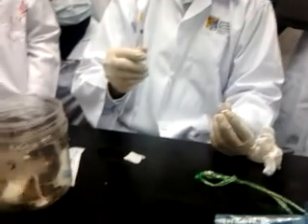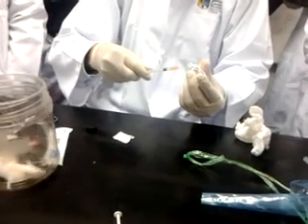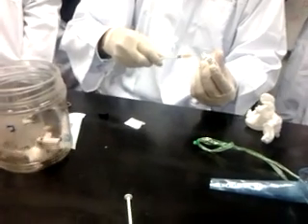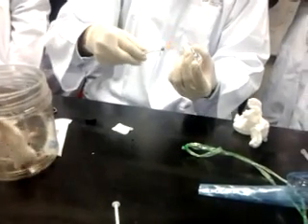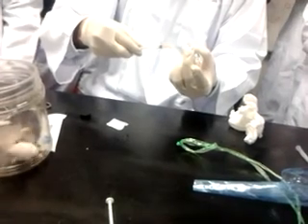The most difficult part of IV inoculation is the mouse, because the veins are small, that's one. Second, they have a very short tail. If your fingers are big, it's quite difficult to hold the tail of the mouse and give IV, so you have to get somebody to help. You have to do it slowly until you get the idea of how to inoculate it.